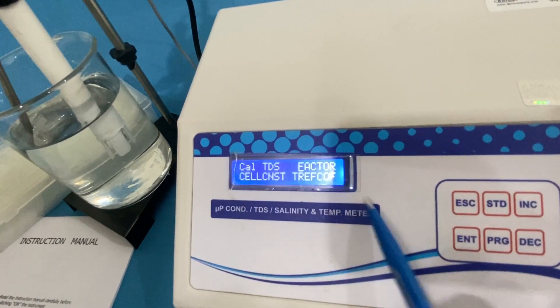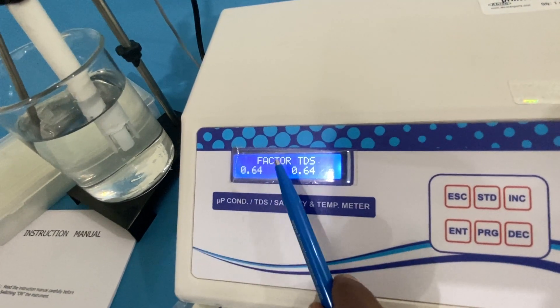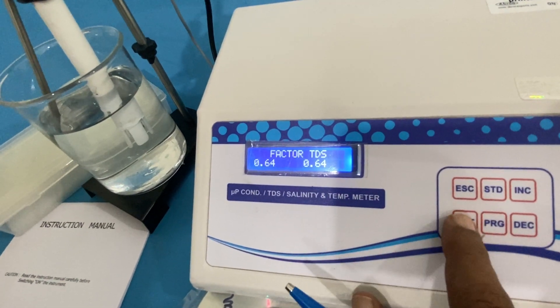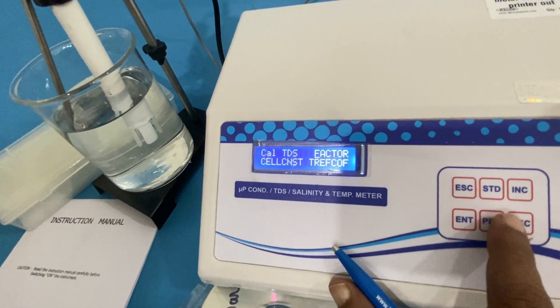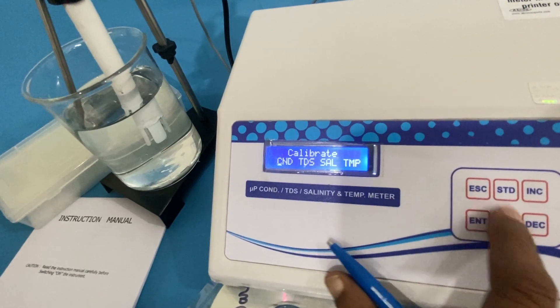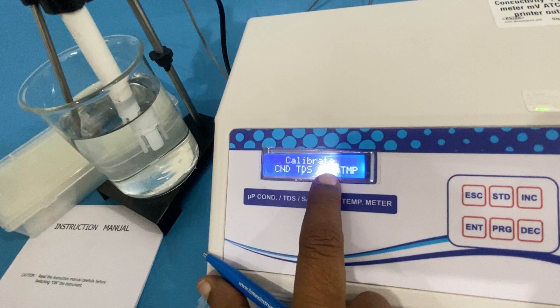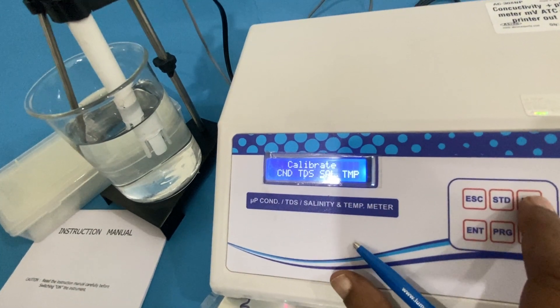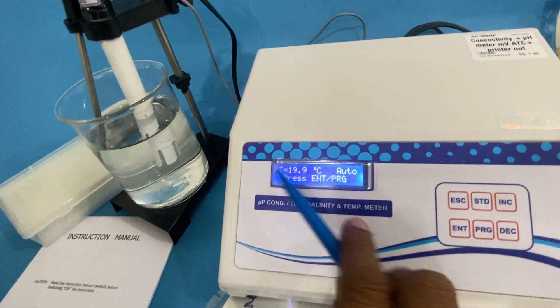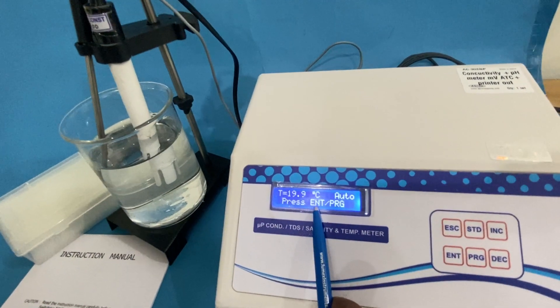It tells you the program mode and the TDS factor that is already set. I enter it, so then the program is ready for TDS. Then I go to programming salinity. If I go with the salinity, I press enter and then escape. Now this automatically will tell you the salinity reading.